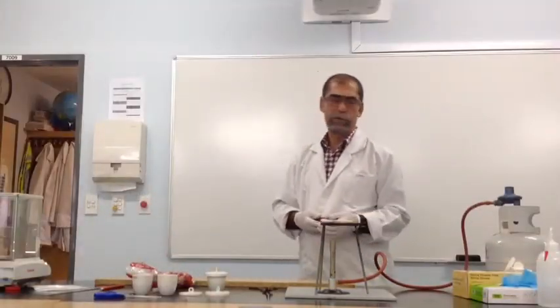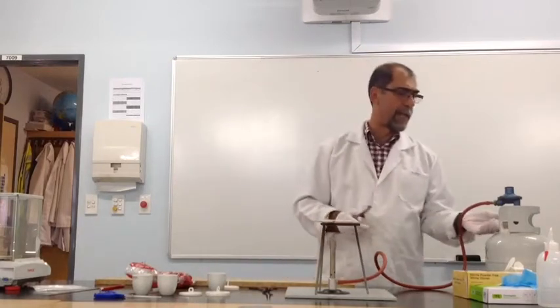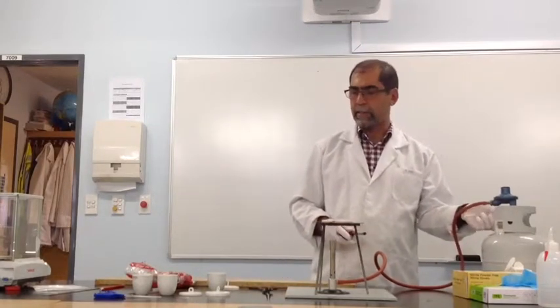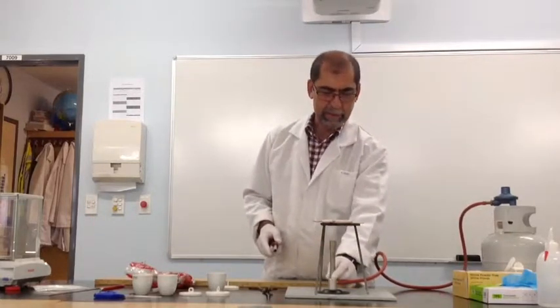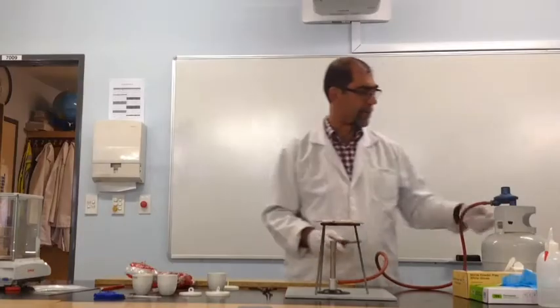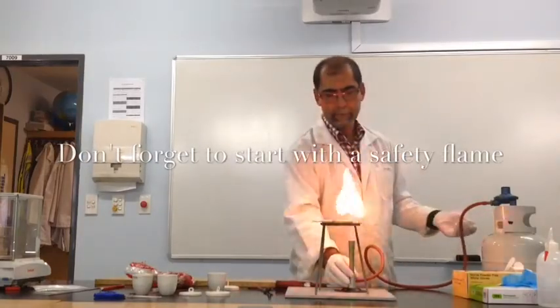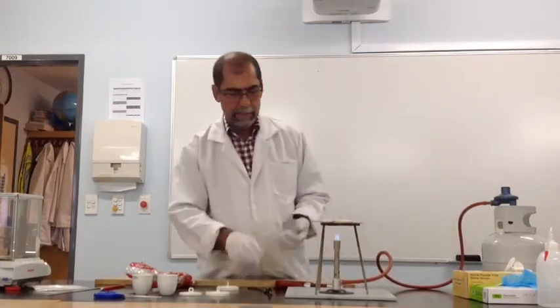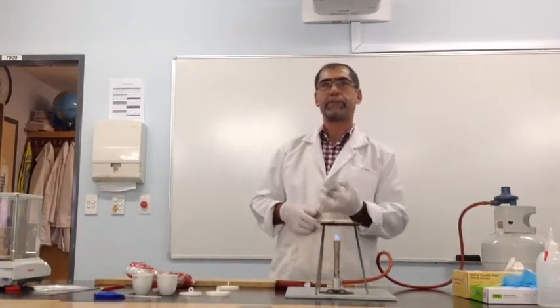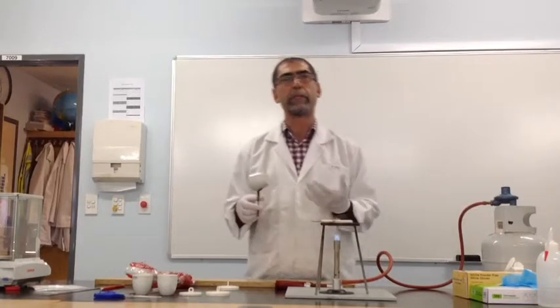The first job is to treat our crucible and its lid, making sure any organic matter that it may contain has been burnt off. So that's our starting point. I'd like to also mention that the crucible is at the moment cold, especially if you're doing this in winter.